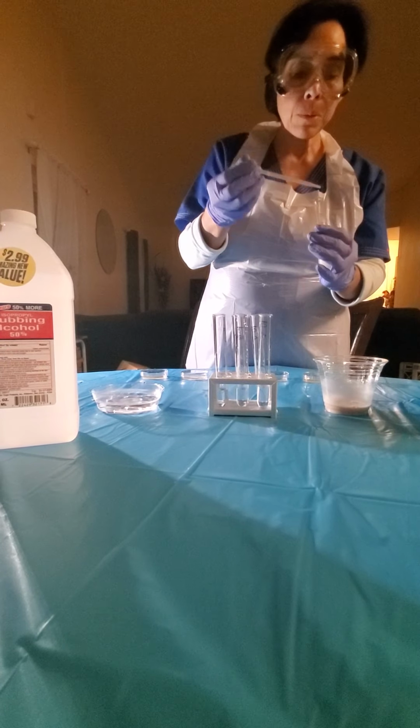Same process, we're gonna take the 0.25, and then we're gonna take tube number 2, and we're gonna do number 2.